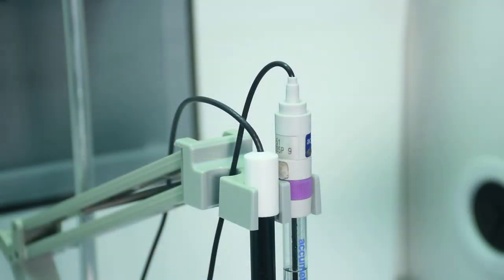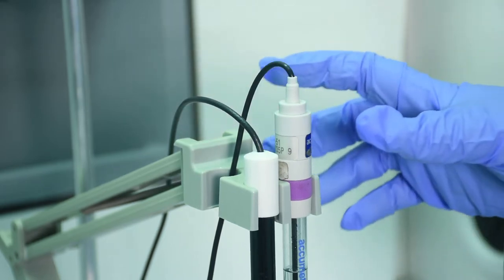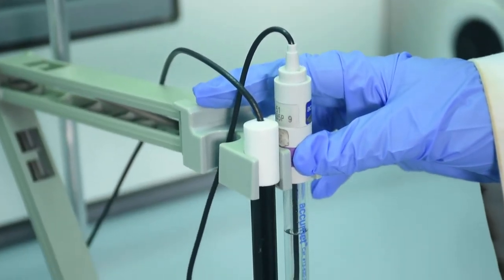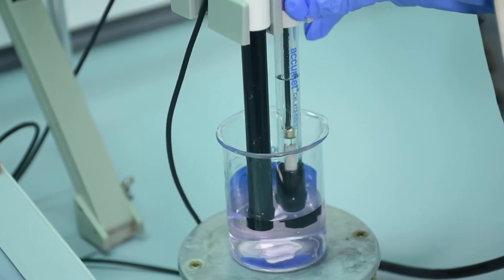Now it is time to measure our first standard. Slowly lower the arm with the ion-selective electrode and the reference electrode into the solution.